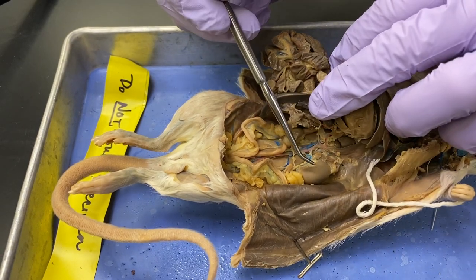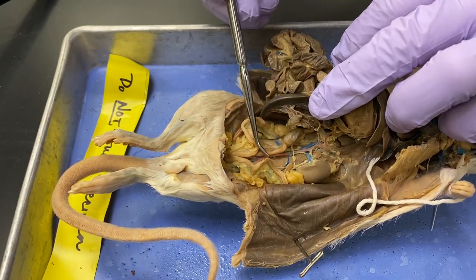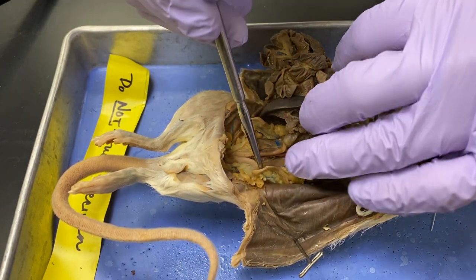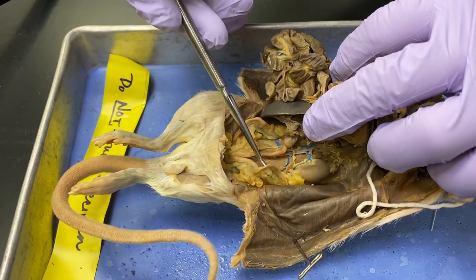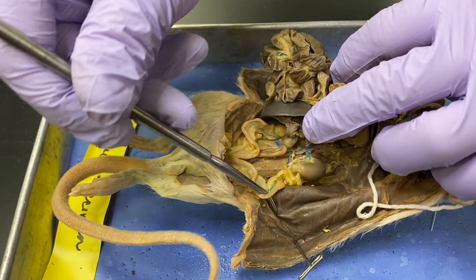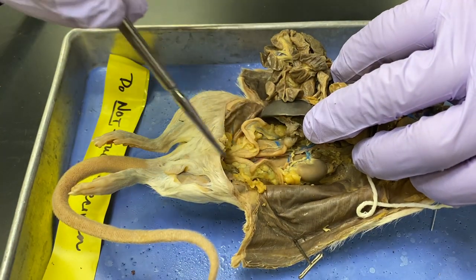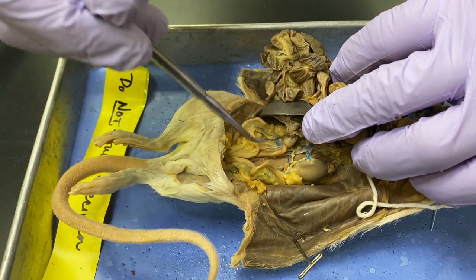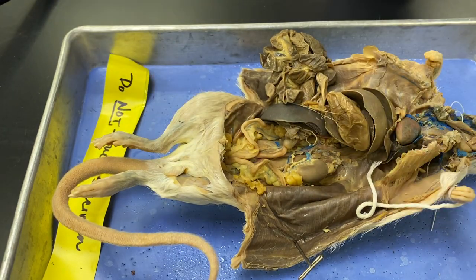So here we see, same side — kidney — and we can actually get a pretty clear view. There's a big oviduct right there, uterine horn, or whichever term you want to use. But I'm going to try and push down and get my fingers out of there.